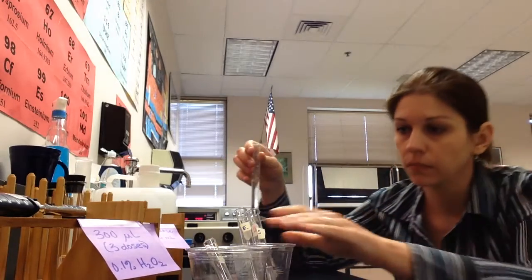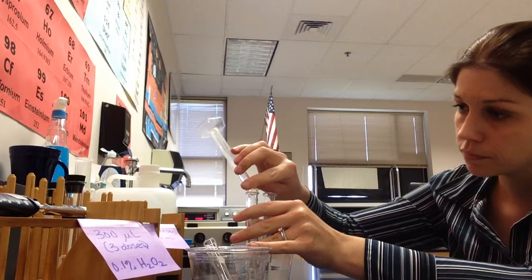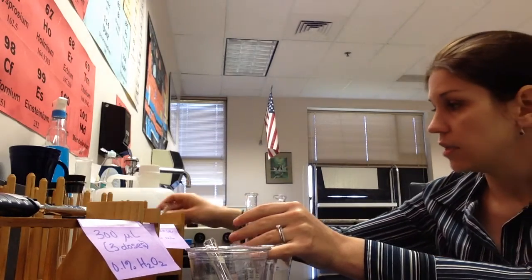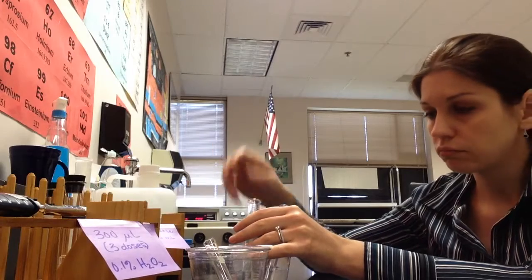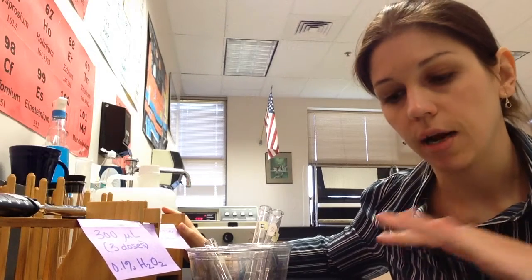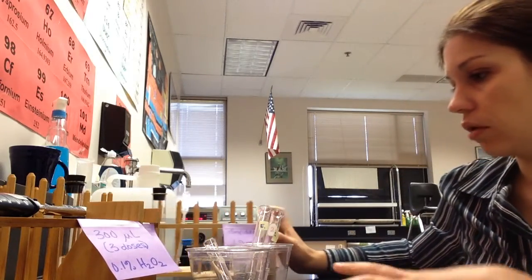Okay. And enzyme. And we're good to go there. The only other thing I need for my enzyme tube is my enzyme. And so I will have wooden test tube racks set up in a couple of different locations, clearly labeled with what's what, because I don't want you guys to get the wrong stuff. And that's really the only way this lab can go wrong.